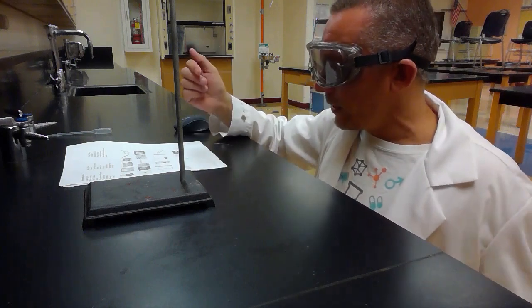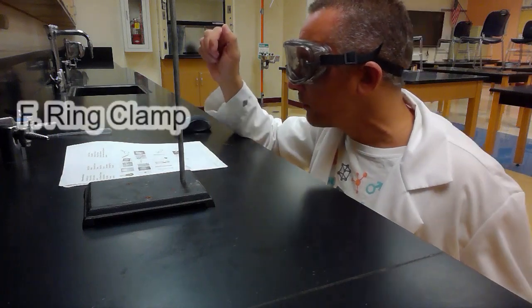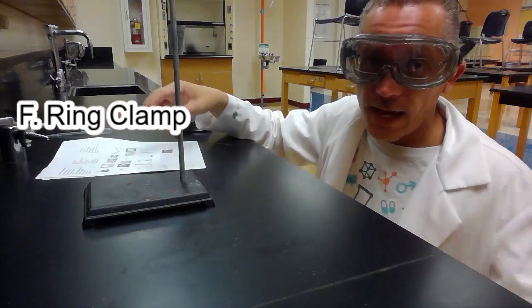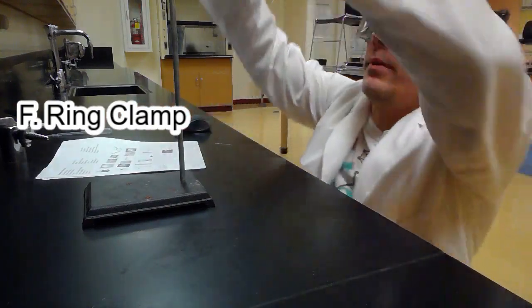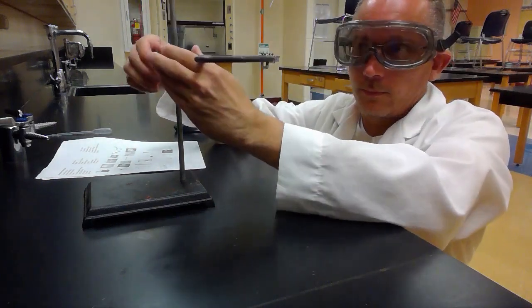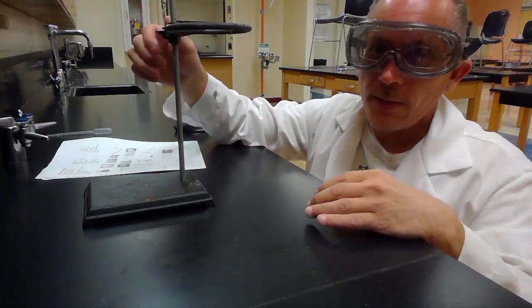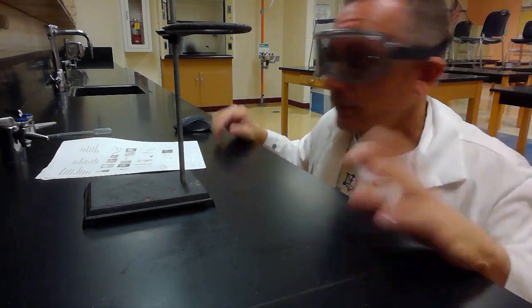And on my ring stand, I'm going to put picture, which one is it? F. Picture F is a ring clamp. I'm going to put my ring clamp on there. And you can see it holds up my ring clamp, right? And what does my ring clamp do? It holds some stuff up, okay?